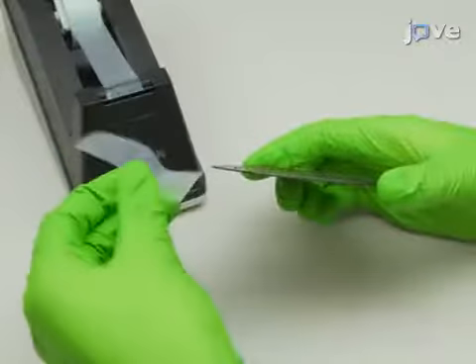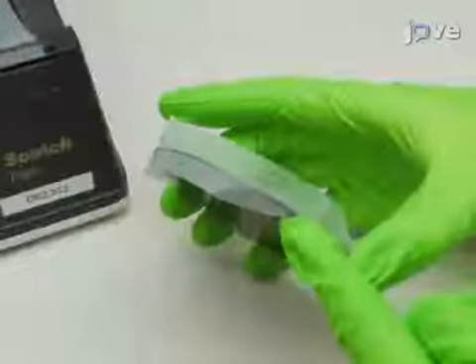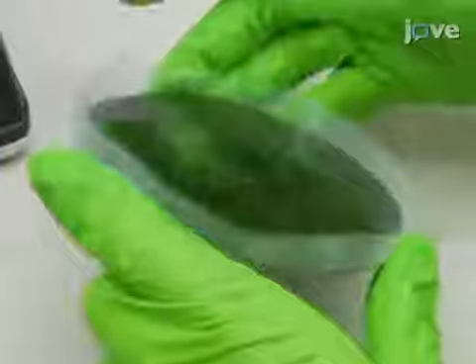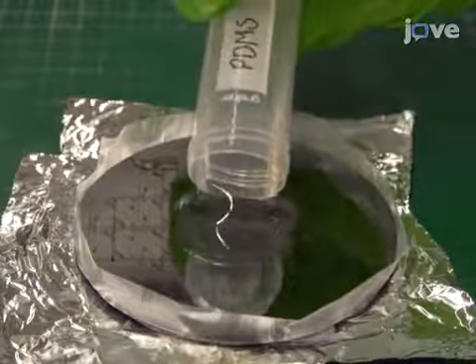Meanwhile, prepare the mold for the liquid PDMS mixture by sticking clear tape around the mold or placing the mold in a suitable wafer holder. Pour the degassed PDMS mixture onto the mold.